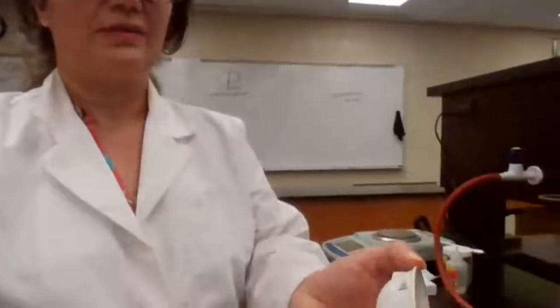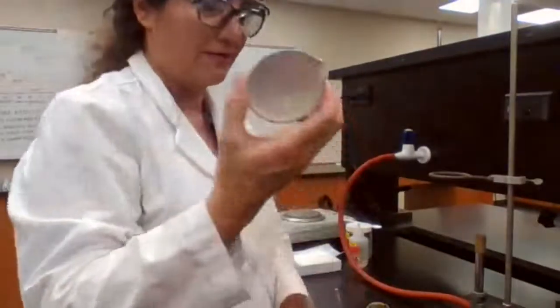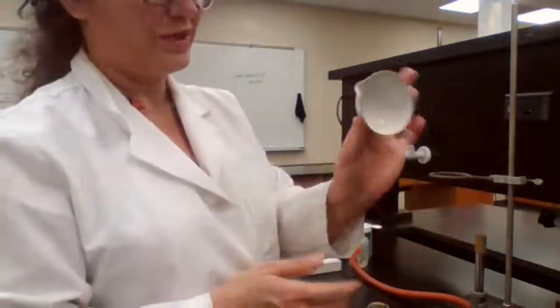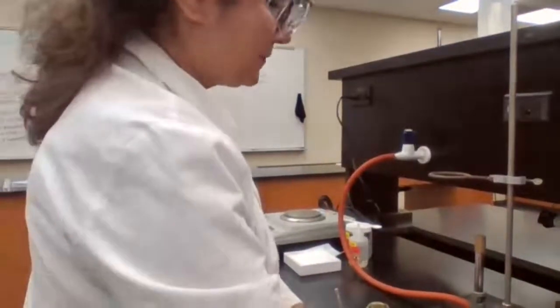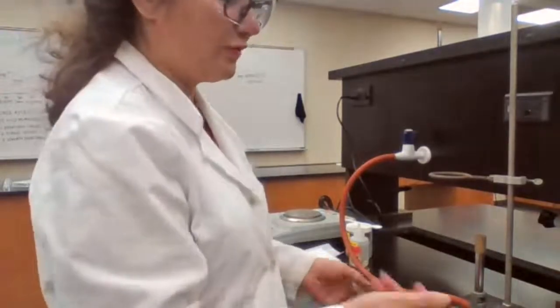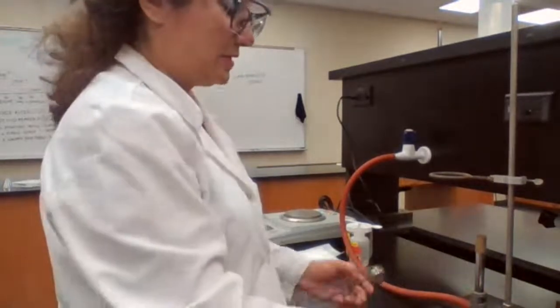So we are going to first heat up the evaporating dish, we're using a Bunsen burner. We are going to heat up the evaporating dish to get a fixed mass, because if there is any extra volatile compound or moisture on the evaporating dish, it's not going to be the same as if it was completely clean and dry. So in order to remove anything excess from the evaporating dish, we are going to fire the evaporating dish on Bunsen burner.